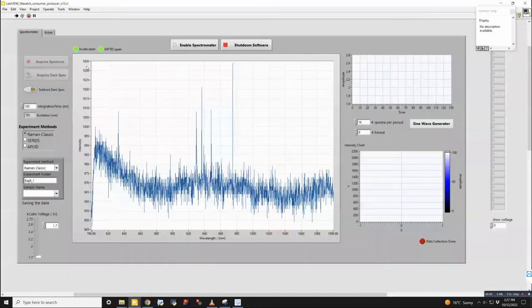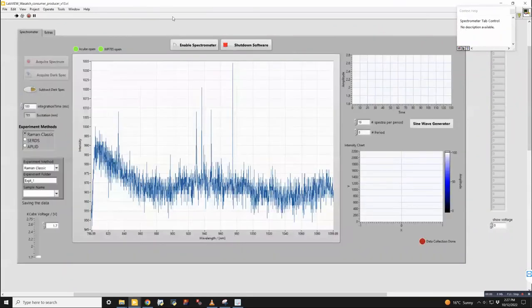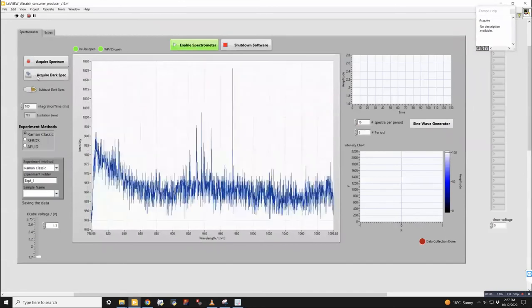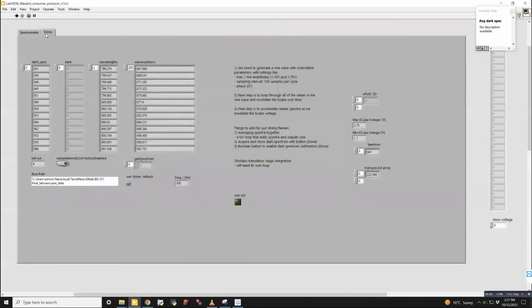If I've clicked acquire dark spectrum, this will be true, and it will feed this spectrum that it just captured into a variable called dark spec. And this is sitting in the extras panel over here. So this is where we actually save our dark spectrum. So if I enable the spectrometer here, you'll see that these buttons are back. And if I click acquire dark spectrum, so I'll be clear about this, dark spec is an uninitialized array. And what we want to do is fill this with the spectrum when everything is off. So I click this, and then now we have a dark spectrum in this variable.